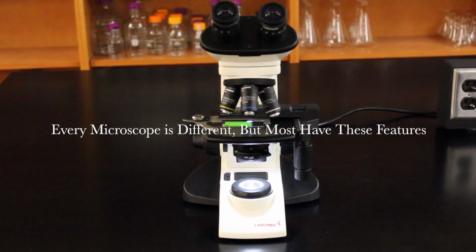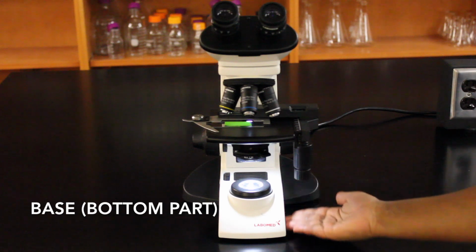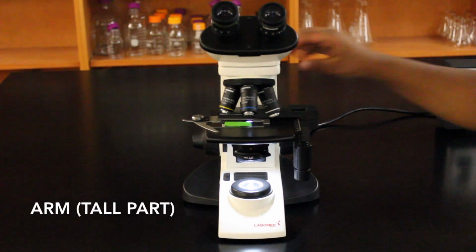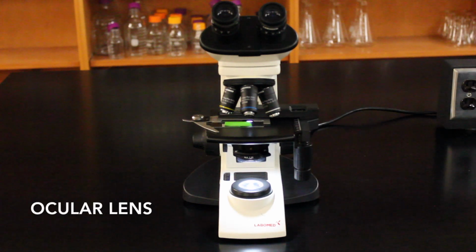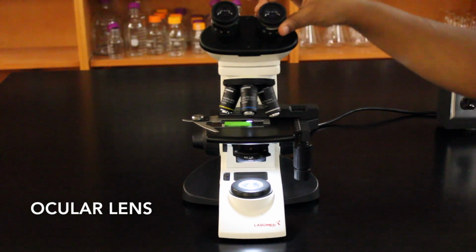Every microscope is different, but most have these features. The base is the bottom part of the microscope, while the arm is the tall part that's being grabbed right now. When you use it, you'll put your eyes up to the ocular lens. You can see this here. This is naturally what you want to put your eyes up to.